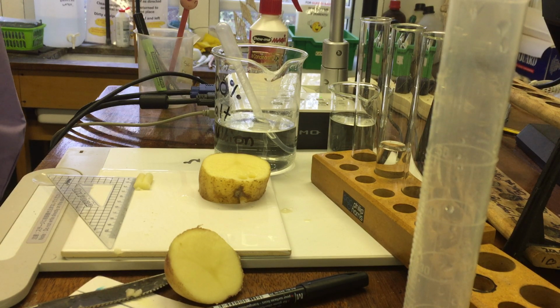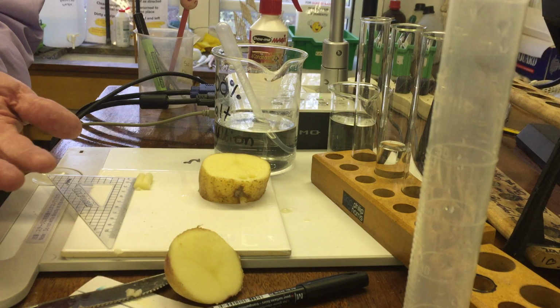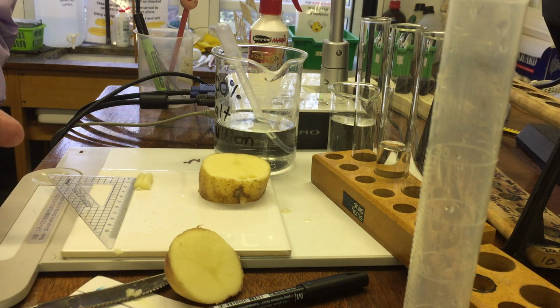So put the potato chips into the solution, and then we're going to leave it for about an hour. Okay, it's about the amount of time we've got, and then you'll come back, and then all the person has to do when they come back is they have to take them out one at a time. Just put your hand out, pour the solution through your hand, okay, so you catch the chip, and then put the chip onto a paper towel with a number next to it, say which number it is, 1, 2, 3, 4, 5, okay, 0, 25, 50, 75 or 100. Then take it over to the scale, all of them together, and then just weigh them one after the other.